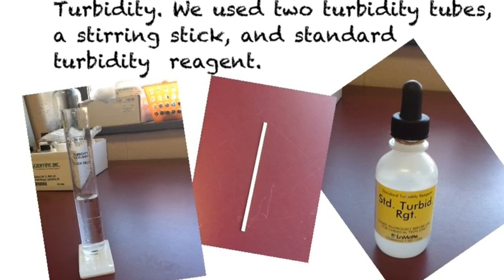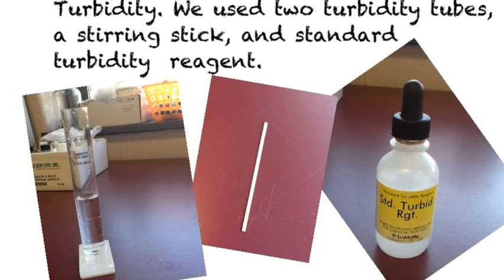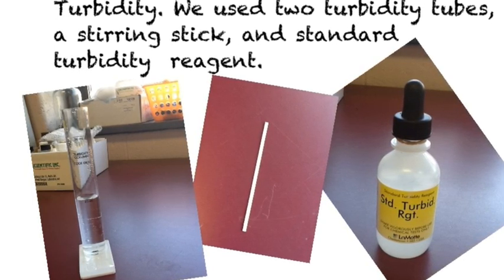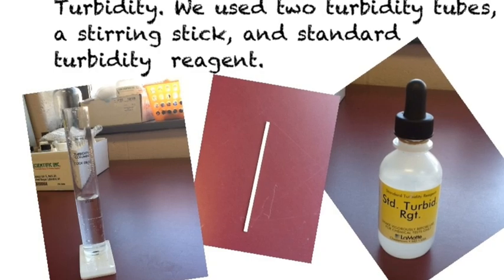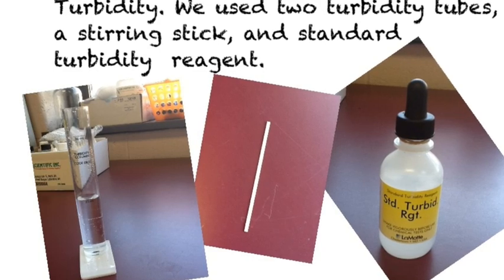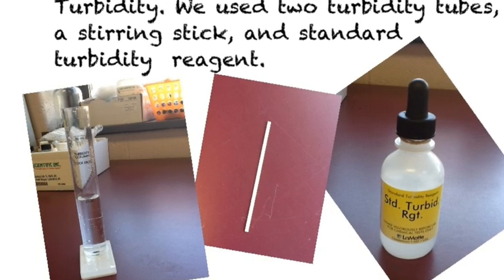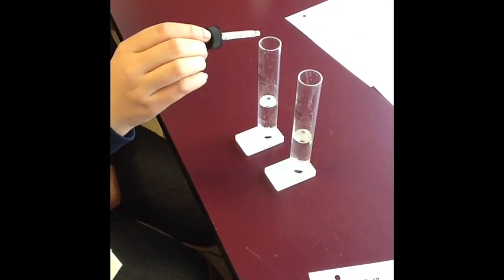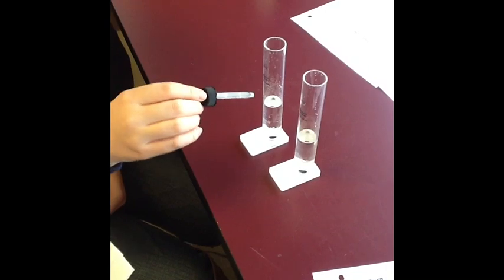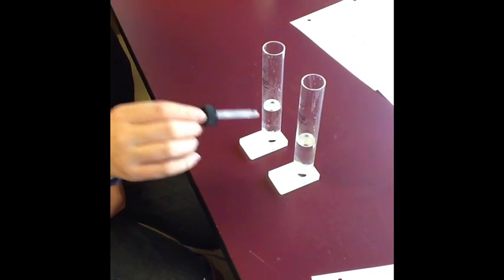To test turbidity, we used two turbidity tubes, a stirring stick, and a standard turbidity reagent. On the left side is distilled water, and the one on the right is lake water.